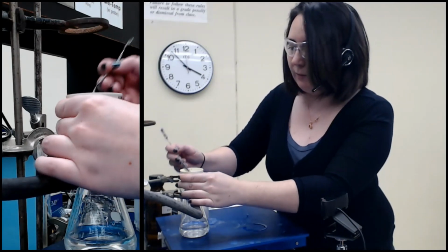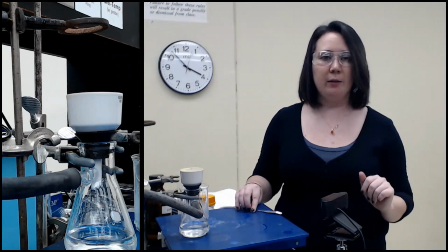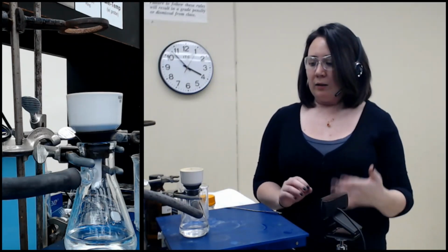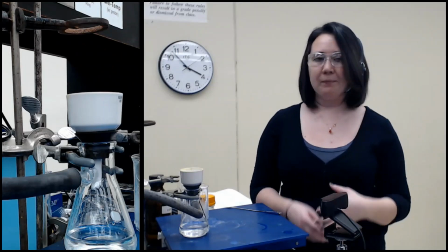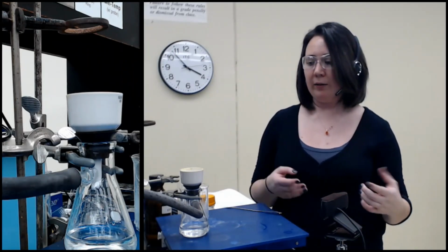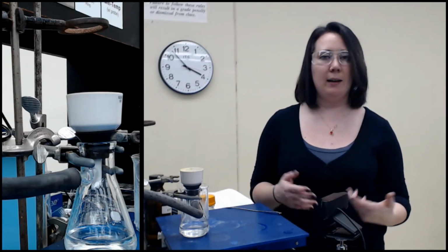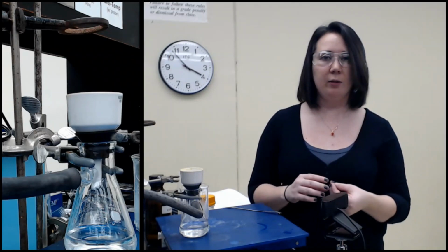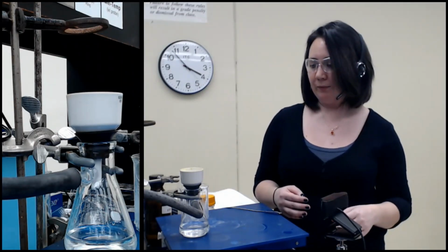A lot of times, it's not 100% of the time, but a lot of times you can get a feel for whether a solid is dry or if it is sticky. So if it releases from the glassware very easily, or just kind of crumbles apart, that's typically a sign that it is dry. If it wants to stick to itself or the sides of something, it's probably still wet.